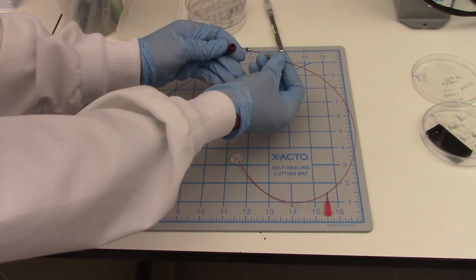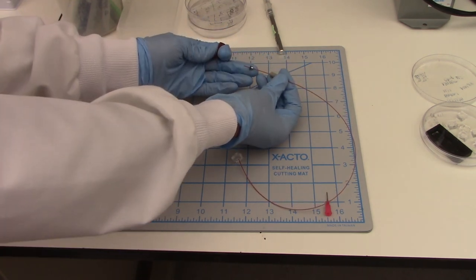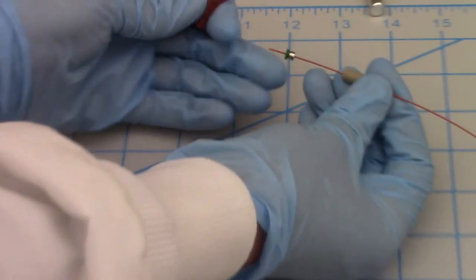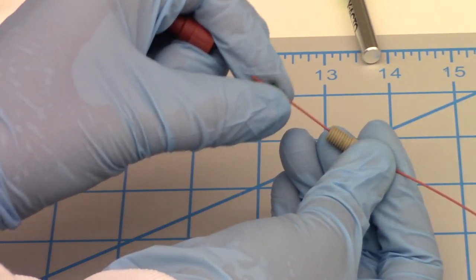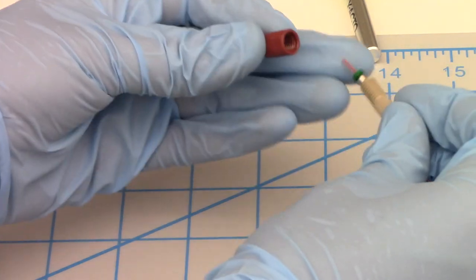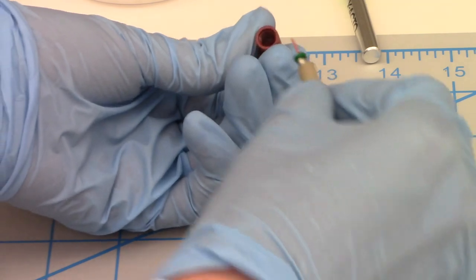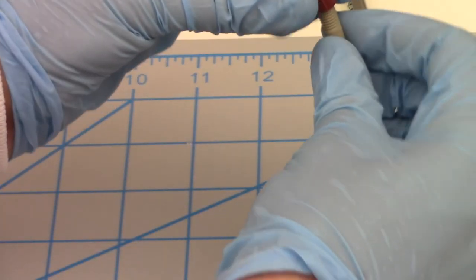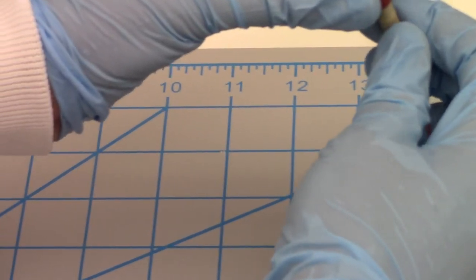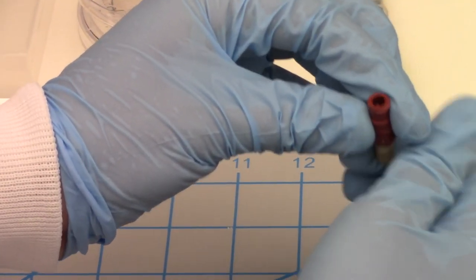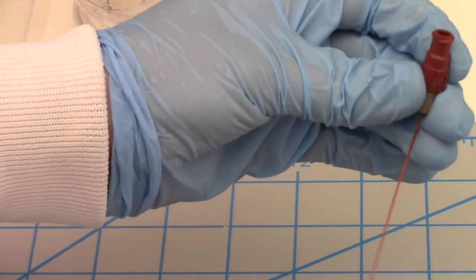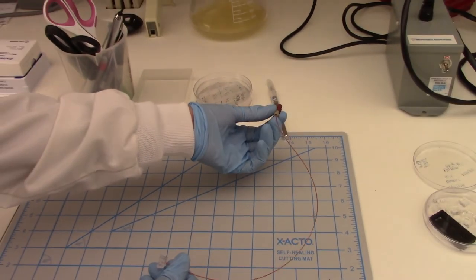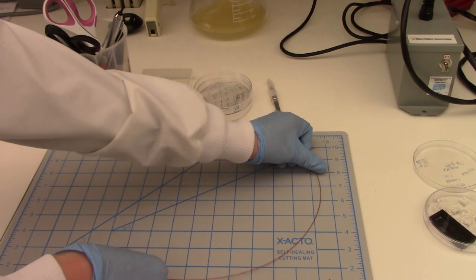Underneath, in order to make sure everything fits together, that we don't get a leak. There's a nut and a ferrule that are tightened together using compression fitting. So once those are on, they should not slide up and down the tubing. When I'm positioning the green and the silver piece, I like to go inside of this red Luer lock adapter. And actually poke, you can't see it very well here, but I actually poke it through just a little bit. But what you'll notice is there's no tubing coming out of the top of this red adapter. And then once I have this set up, I can connect it to a syringe, put that on my pump, and I'm ready to run my experiment.